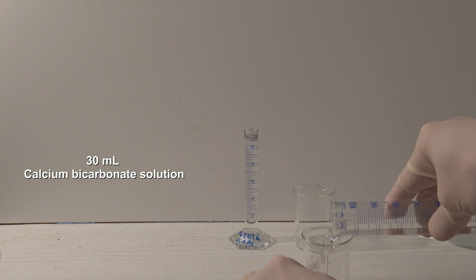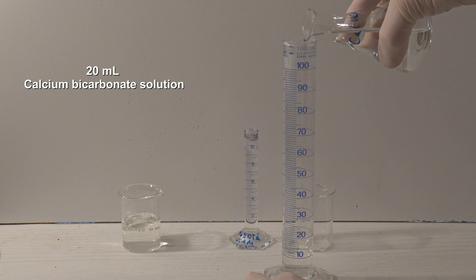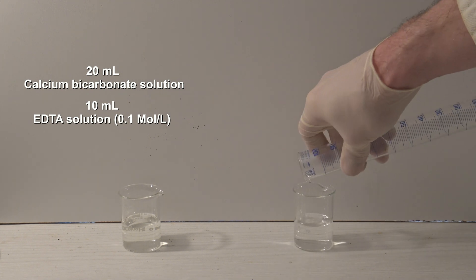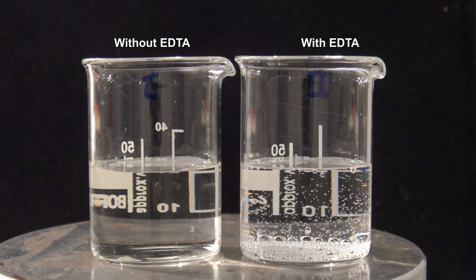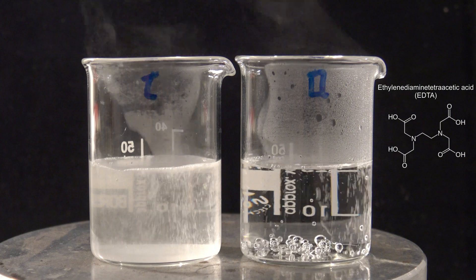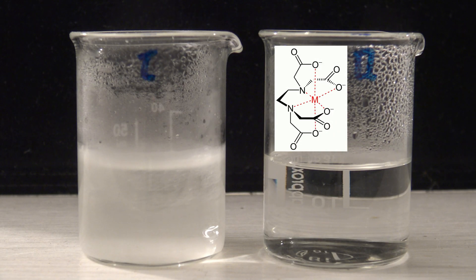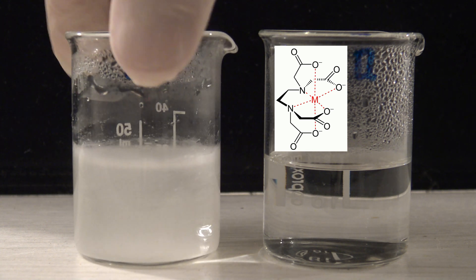As an example, 30 ml of the calcium bicarbonate solution are added to a beaker. To a second beaker, 20 ml of the solution and 10 ml of a 0.1 molar EDTA solution are added. Both solutions are then heated to a boil. EDTA is the sodium salt of ethylenediamine tetra-acetic acid and was used in washing detergents as a water softener until the beginning of the 21st century. EDTA can act as a polydentate ligand and form complexes with metal ions, so it also prevents the formation of lime scale and lime soaps.